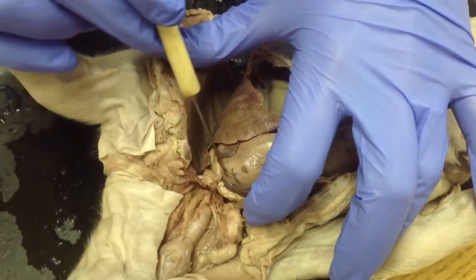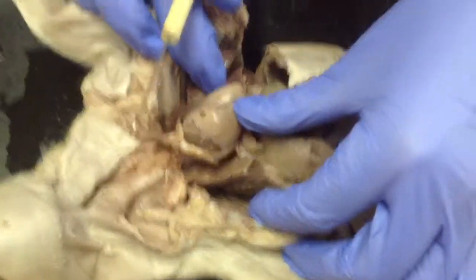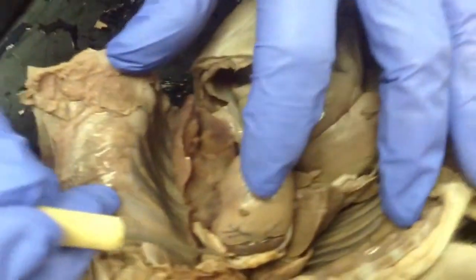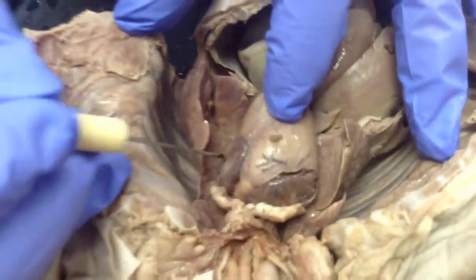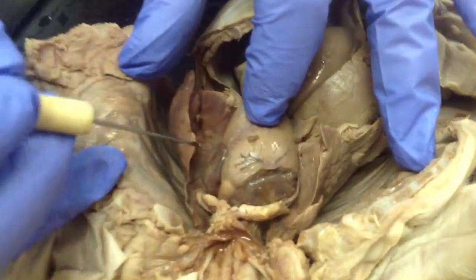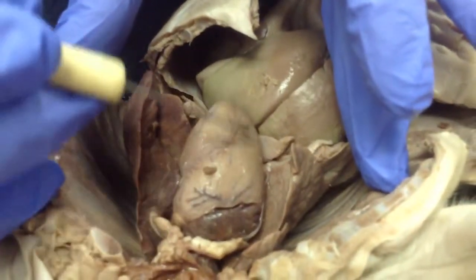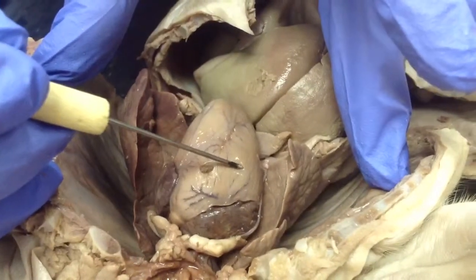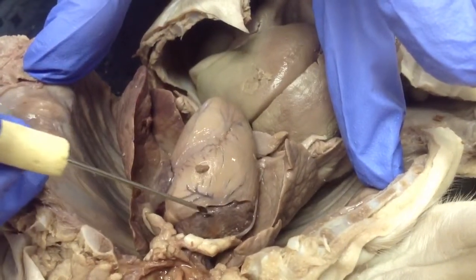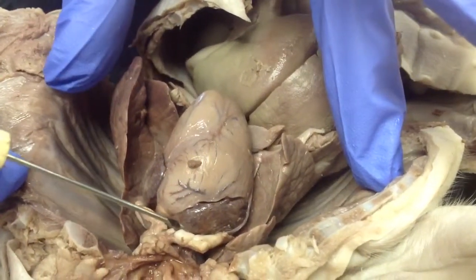What we're going to come across next is the great big heart. And it's this great big thing right here. With the heart, remember mammals have four-chambered hearts. See these two dark structures right here? Those are the atria. So the atria are the two top chambers of the heart. And then this big thing right here is the ventricle, the lower area. So you have the right ventricle and the left ventricle, and that makes up the four chambers of the heart. That just allows better circulation so the oxygenated blood and the deoxygenated blood don't mix.